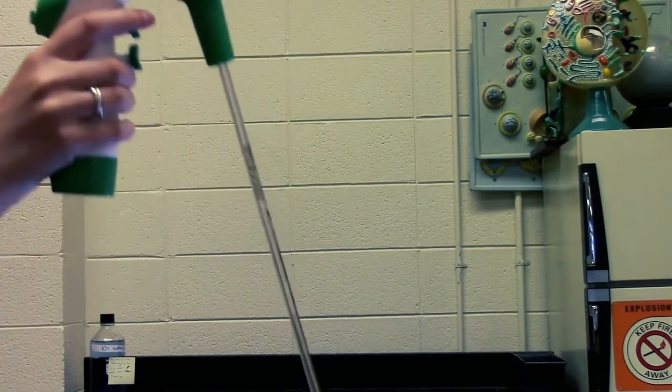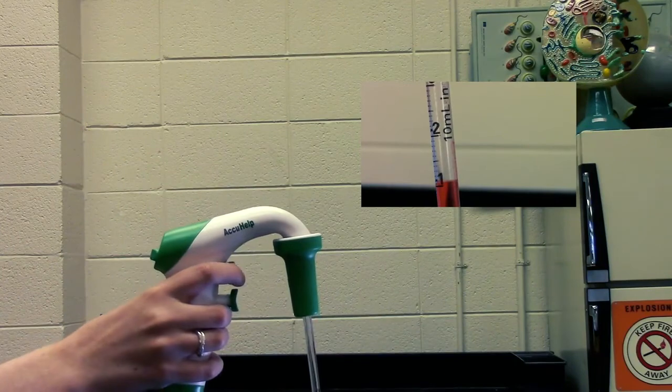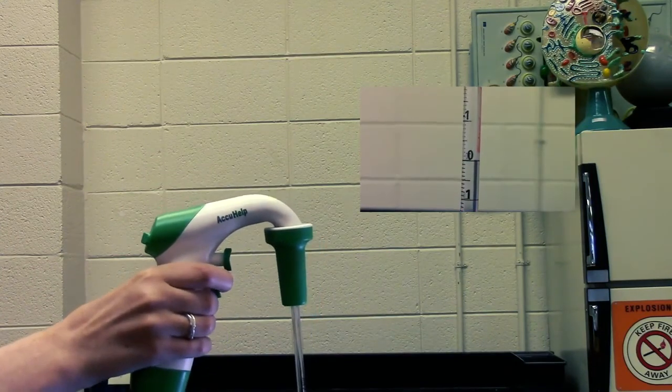This pipette is really easy to use. Simply press the up arrow to take in the liquid and press the down arrow to release the liquid.